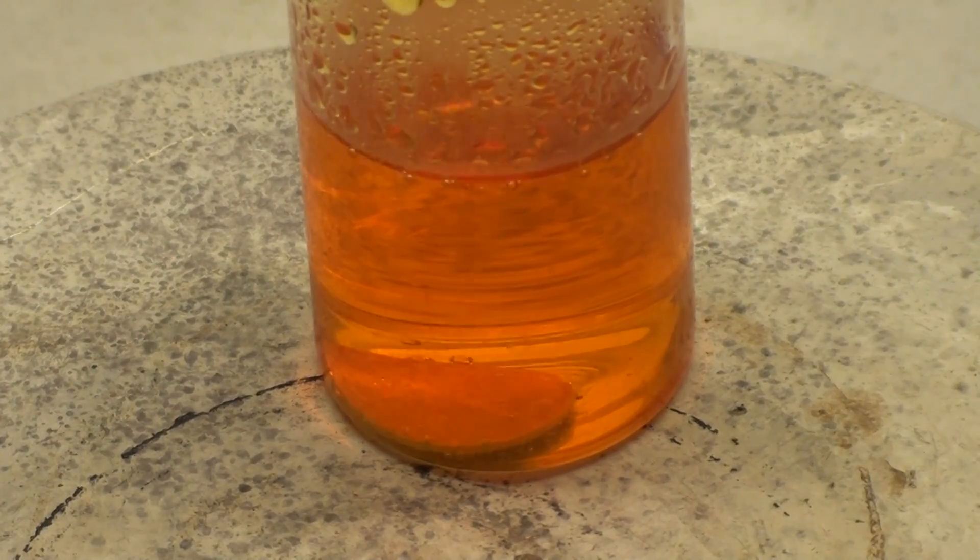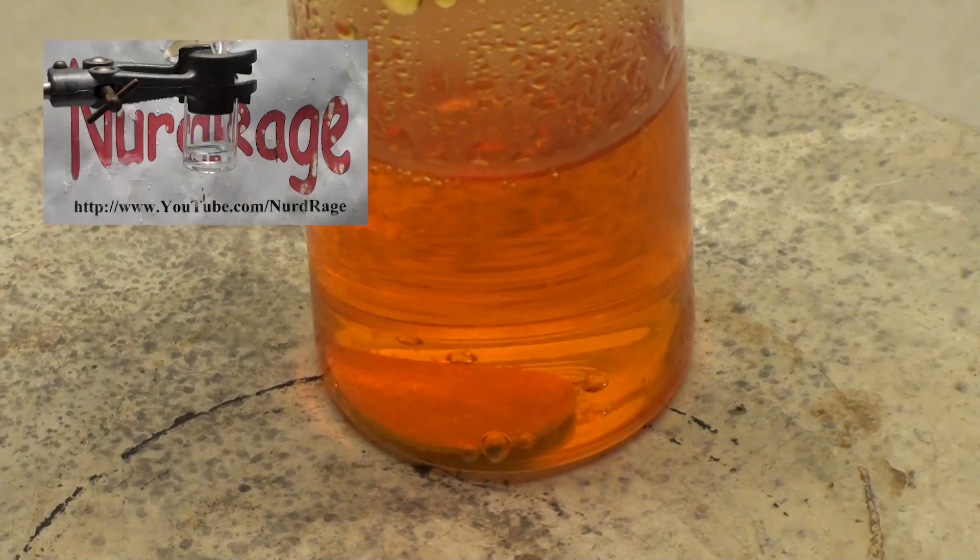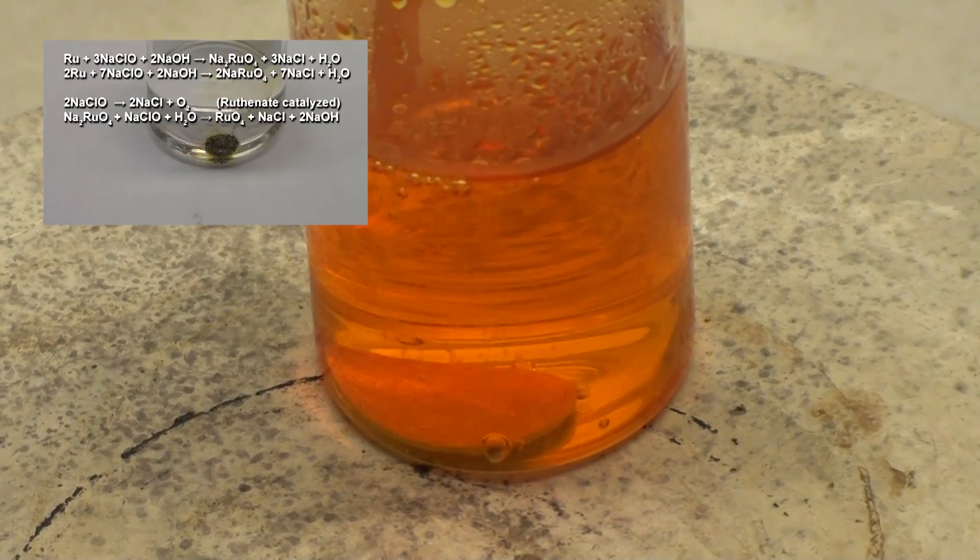Aqua regia does not destroy all metals though. I showed in a previous video that ruthenium is totally immune to aqua regia.